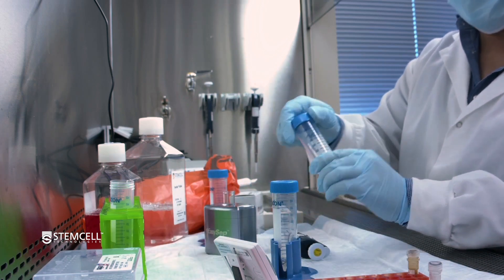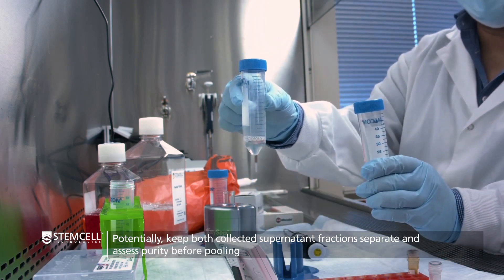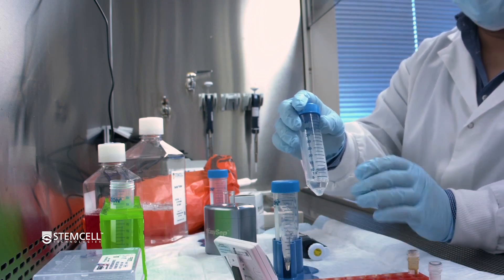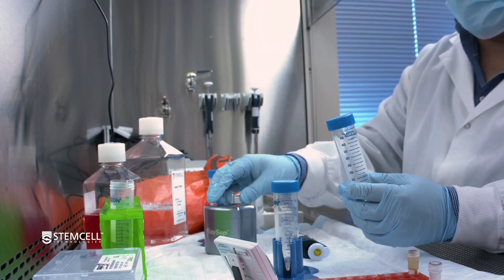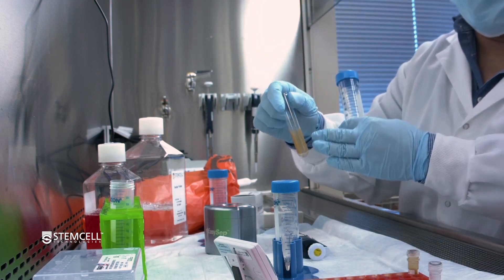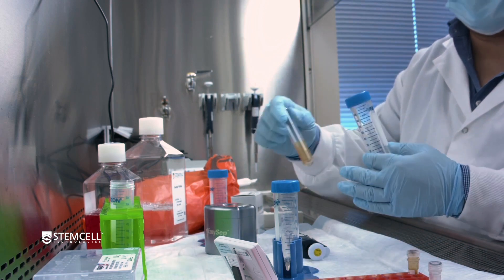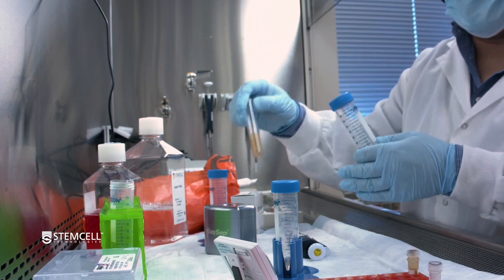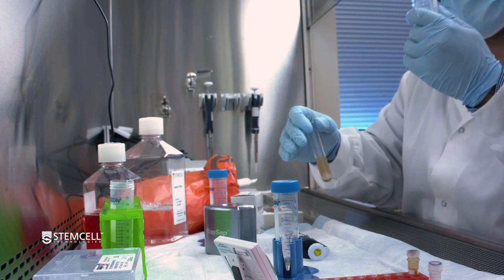So here you have the original NK cells from the first supernatant, and now the hopefully pure and a few extra NK cells. The premise behind this technique is that when you were doing that resuspension and reseparation, you will have liberated some NK cells that could have been interlaced among the labeled cells — so those NK cells that might have been liberated are captured in this second separation.